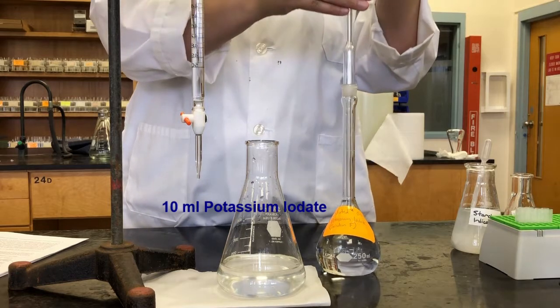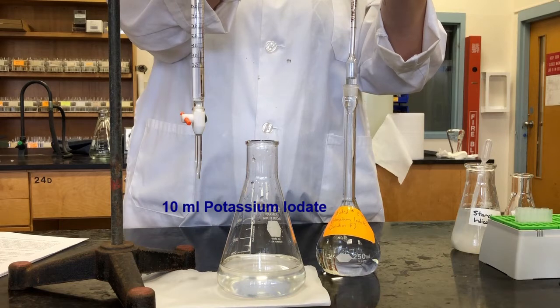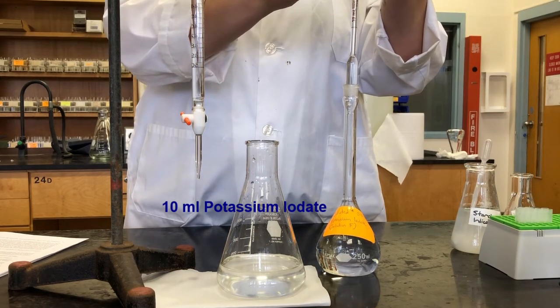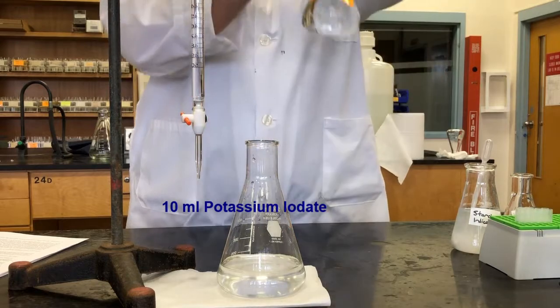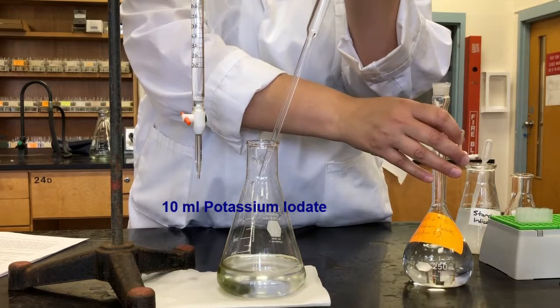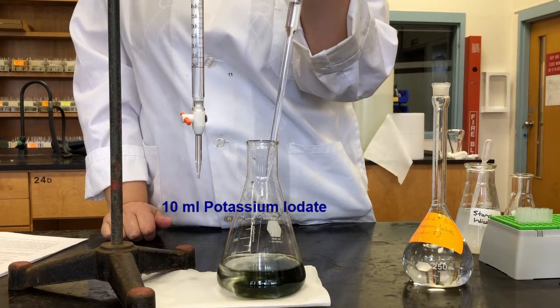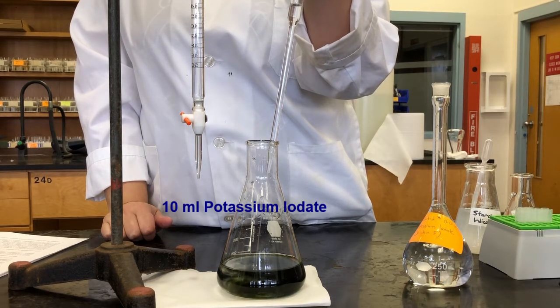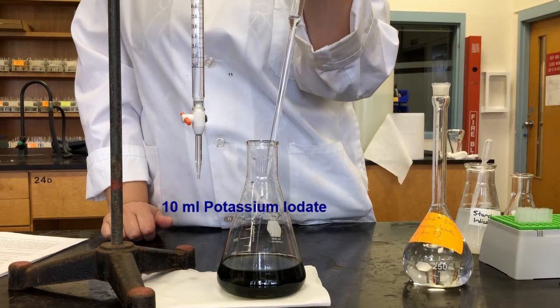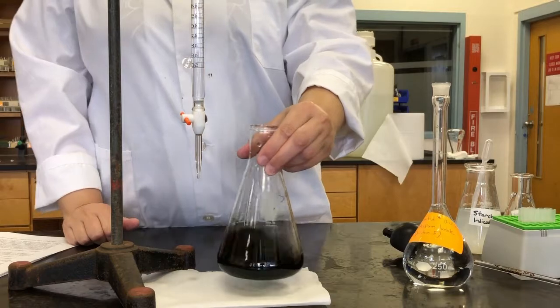So I'm going to use a volumetric pipette and add 10 milliliters of our potassium iodate solution to our flask. You see that bluish green color again? And now we're ready to start our titration.